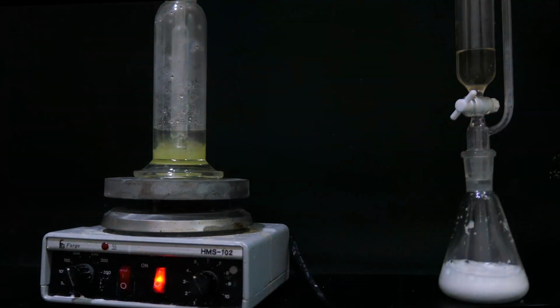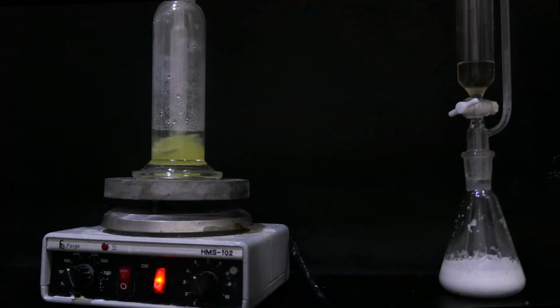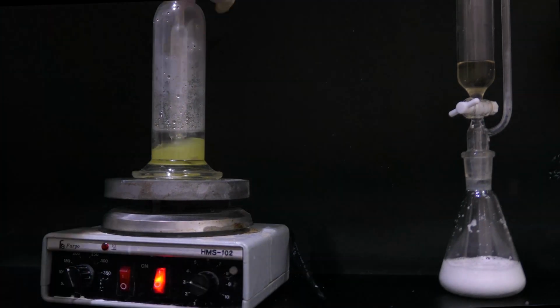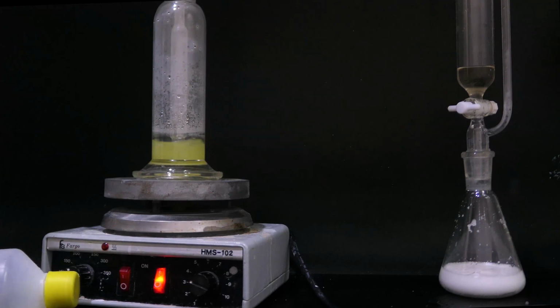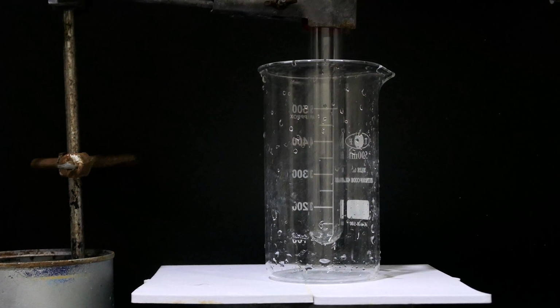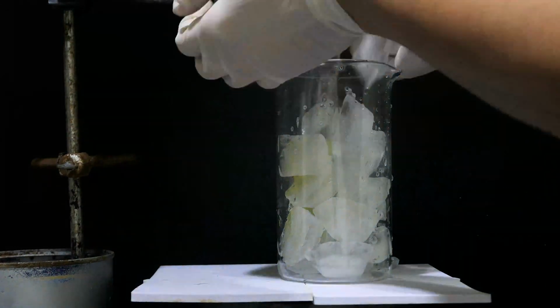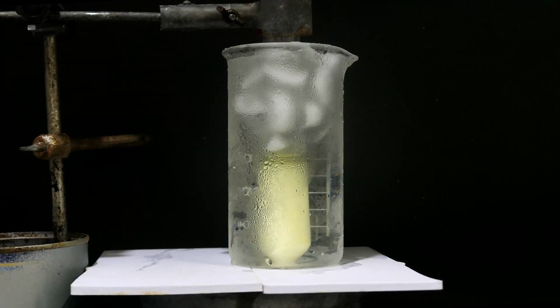Once the solution reaches the saturation point of hydrochloric acid, the generator is turned off. The saturation point can be tested by putting a wet pH indicator strip at the end of the apparatus. If the paper turns red, then it has reached the saturation point. After that, all the liquid is poured into a large test tube and submerged in an ice bath. Crystals of chloroantimonic acid crash out of the solution into a cake.